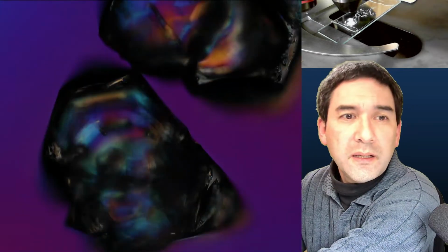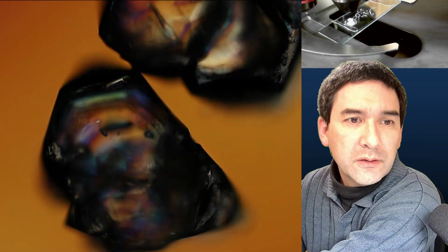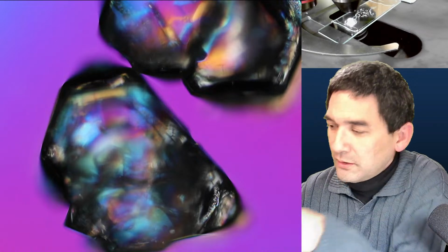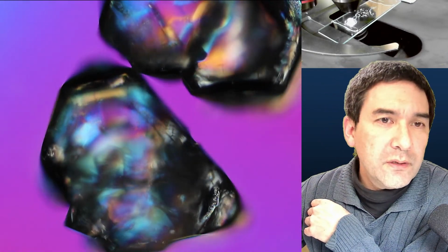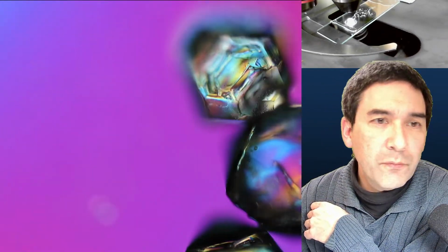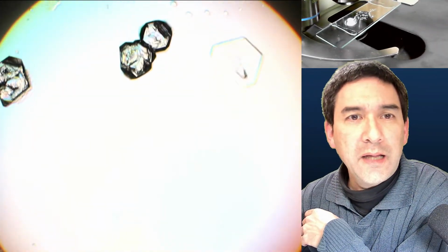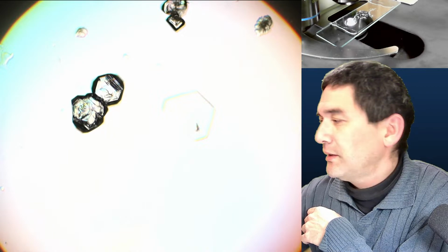Let me put this back in again to give it a little bit of color, because color is nice. And these are the non-dissolved crystals, and I think just before we could also see... Yeah, I lost it again. There were some of them that started to reform. Nope, that's a little bit of dirt. Maybe this is a little bit from the magnification too. Here we go. Here it is. Very faint one.